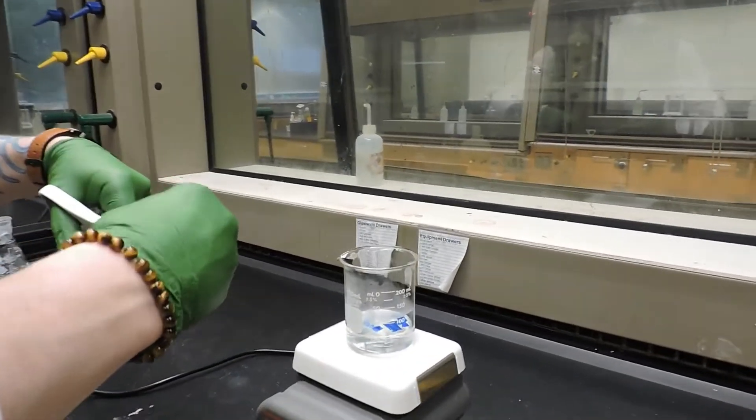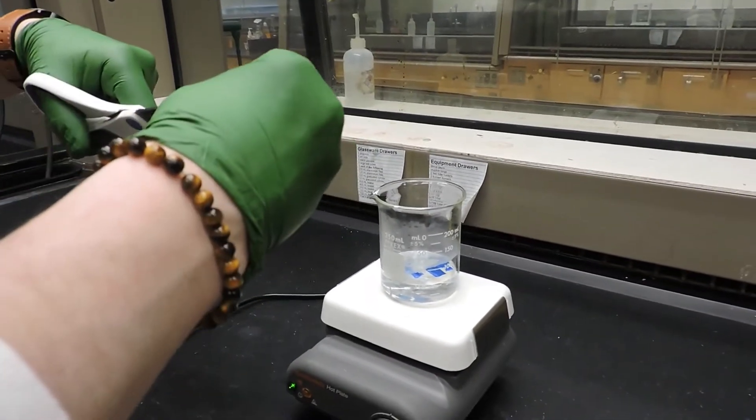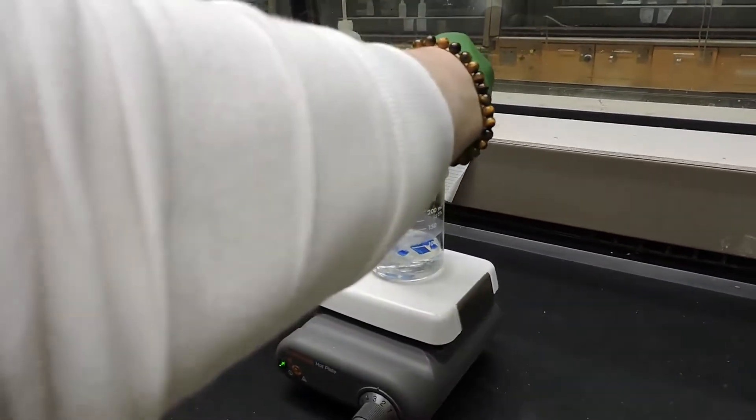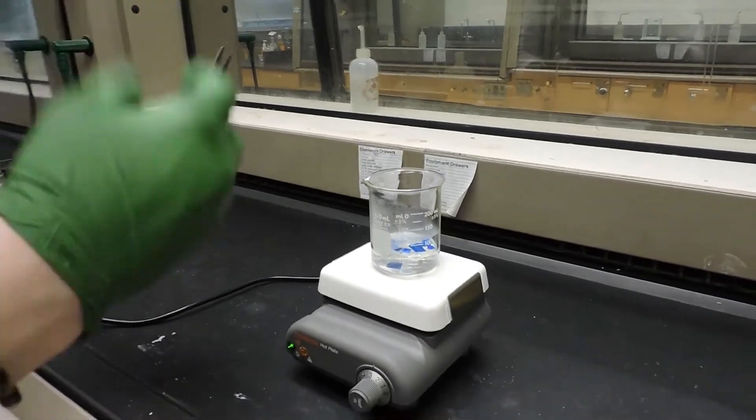This is just a Pepsi can. Yeah, so he's just cutting up bits of a Pepsi can that he weighed out to be 0.888 grams and so he's going to warm it.